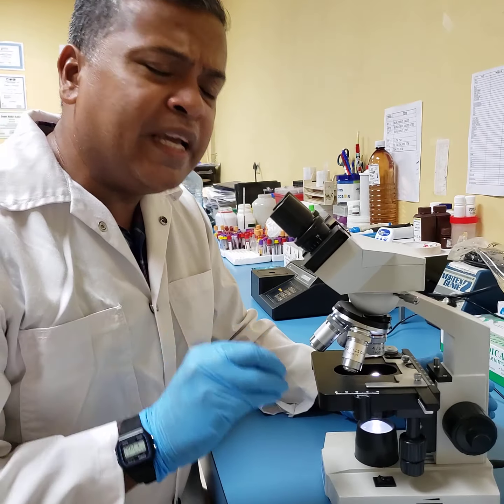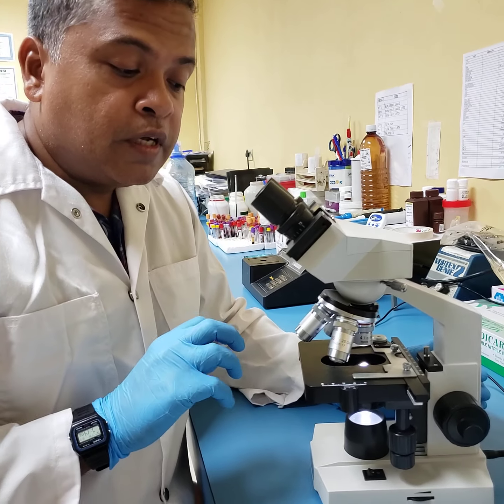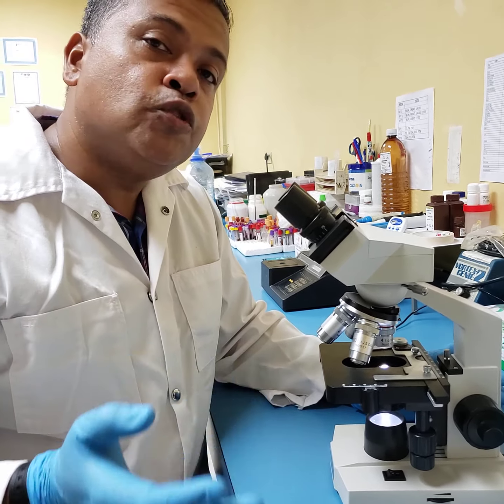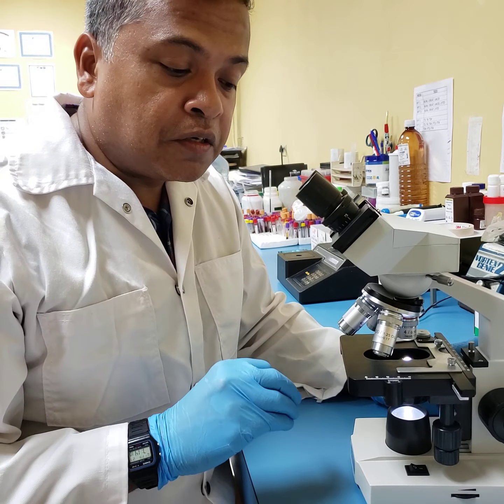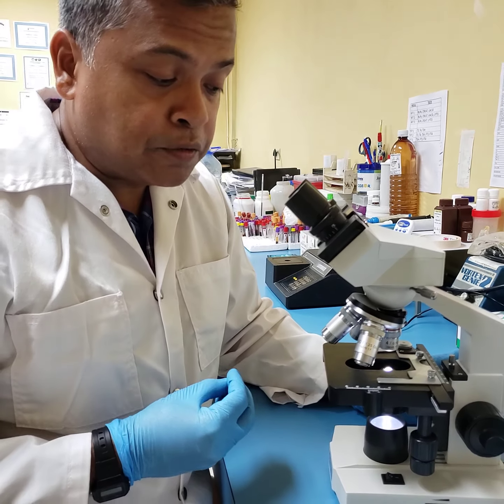This is the beginning of microscopy. This is the place where you would want to begin. I will show you at the end of this session what are the don'ts, or what you do not do in terms of microscopy.